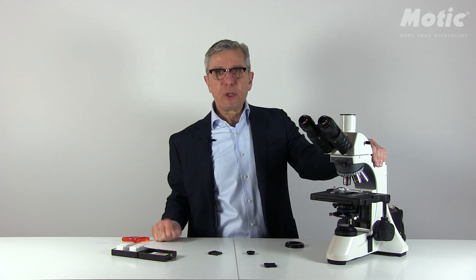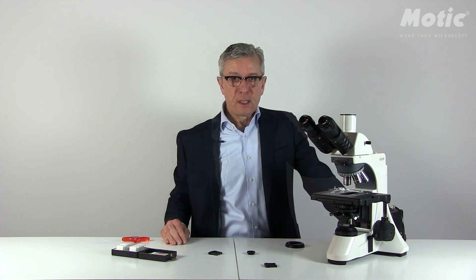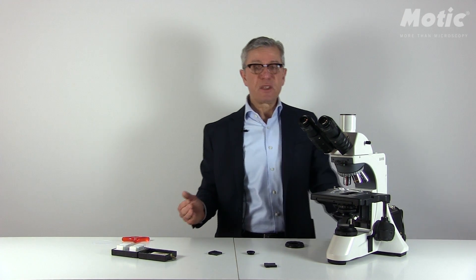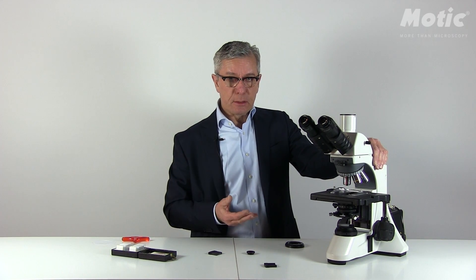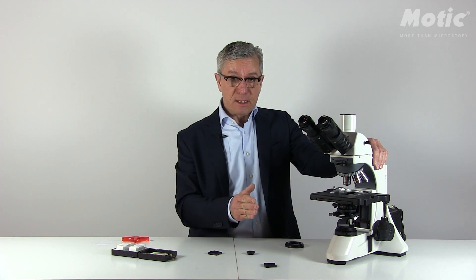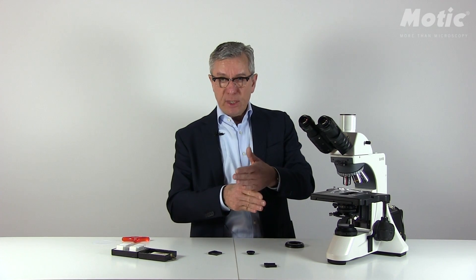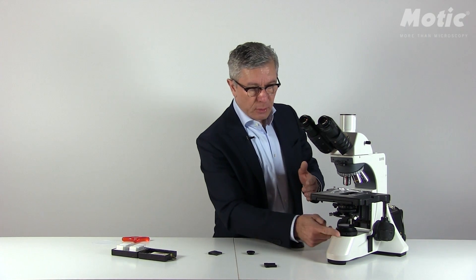This compensator is simply a second birefringent sample which is placed between polarizer and analyzer. It will help us to detect a so-called fast direction and a so-called slow direction within the birefringent sample. This fast and slow direction gives us additional information about the substructure of the birefringent sample, because there is one direction where the light passes faster than the other — and both directions are oriented at 90 degrees to each other, as in the polarizer-analyzer situation.